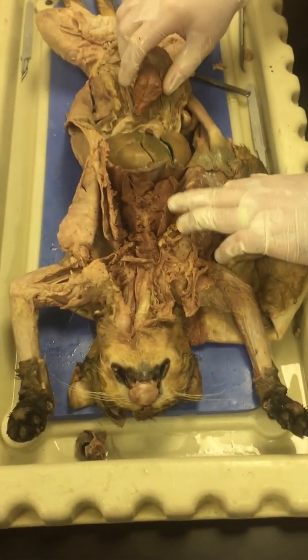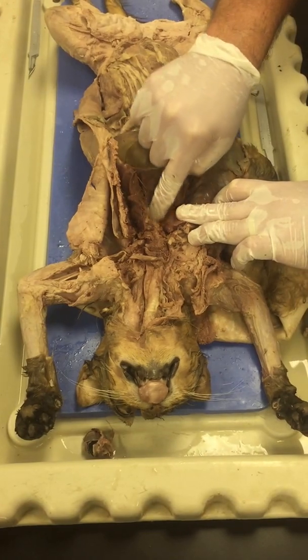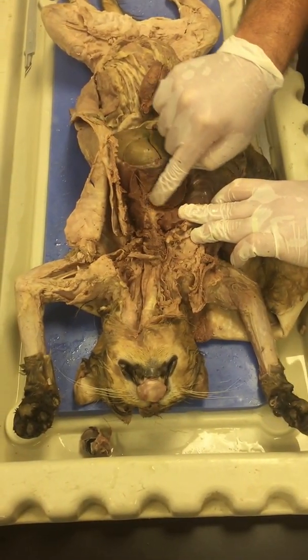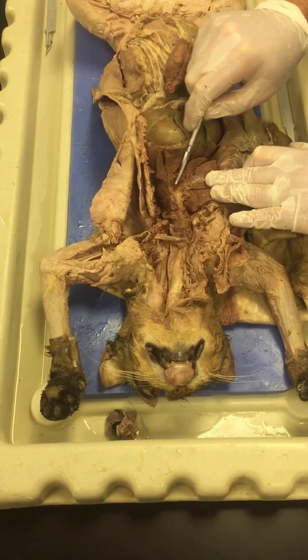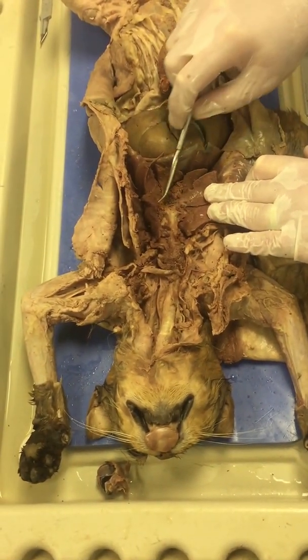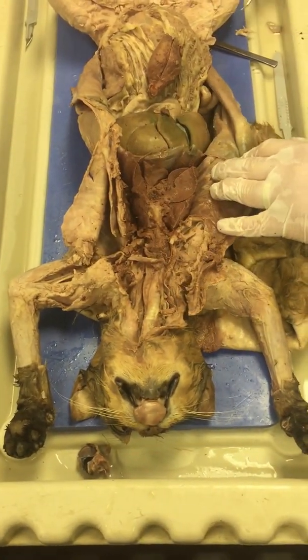Okay, so there's the heart that's been removed there. Okay, so you can see right here that here's the trachea. It branches and goes to both lungs. So you can actually kind of see the bronchi right here. It's one of the bronchi, and right here is the other bronchus. And then they branch in the inside, the little sacs, the alveoli.